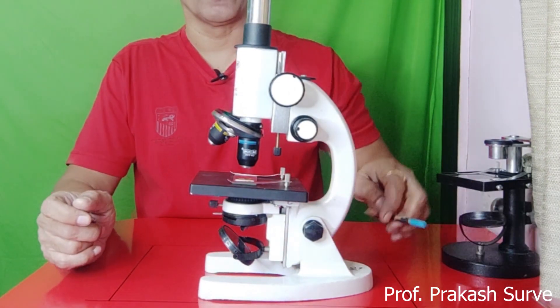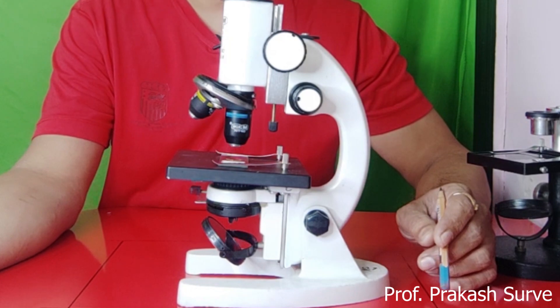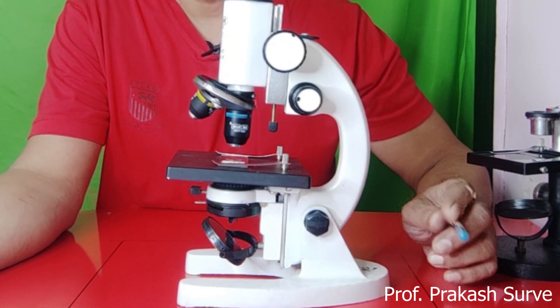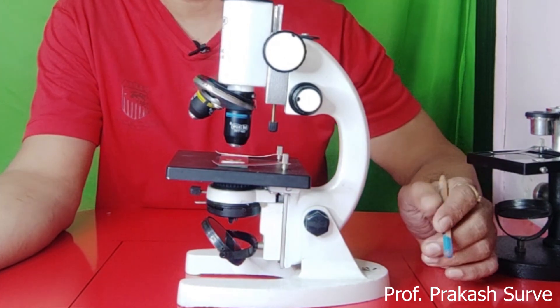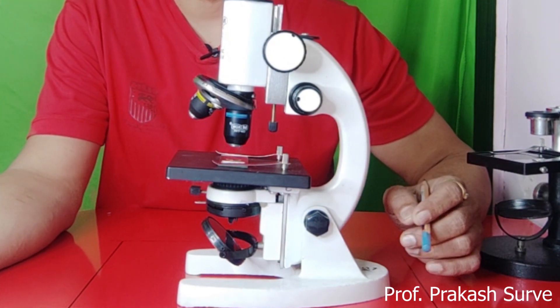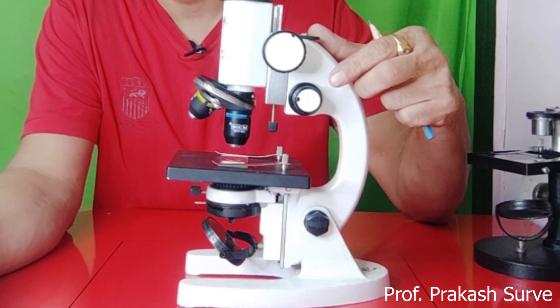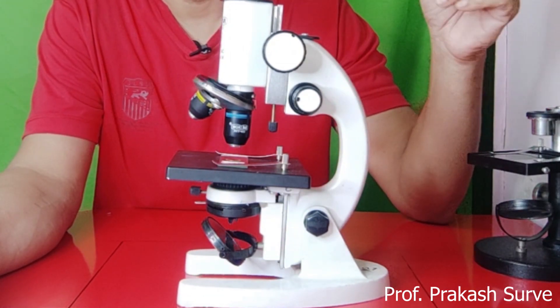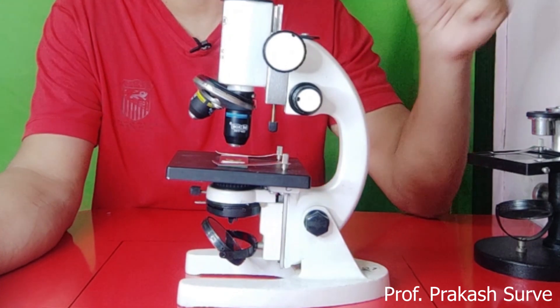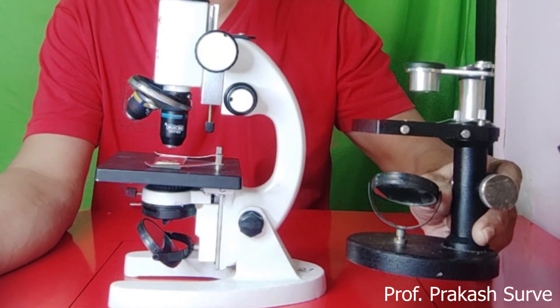Before learning about the different parts of the compound microscope, we will first see the definition of microscope. A microscope is an instrument designed to magnify objects which are not visible to the human eye. There are two types of microscopes used in the biology laboratory: the compound microscope and the dissecting microscope.